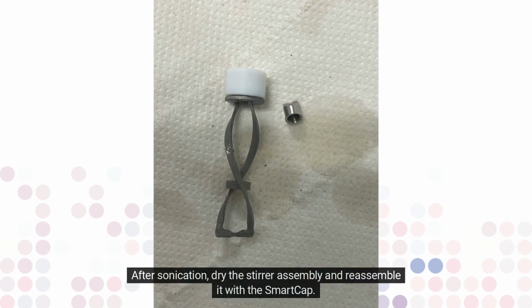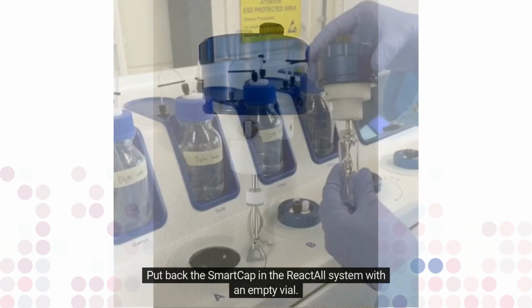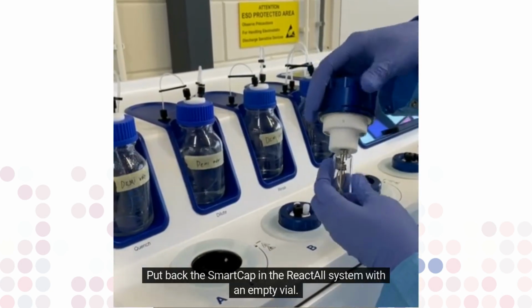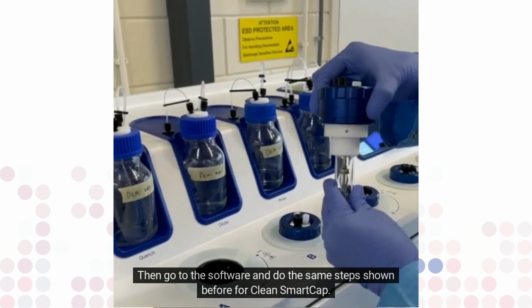After sonication, dry the stirrer assembly and reassemble it with the SmartCap. Put back the SmartCap in the ReactALL system with an empty vial. Then go to the software and do the same steps shown before for clean SmartCap.